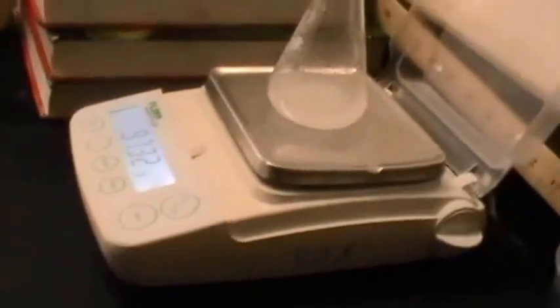And now we've gone down 0.09 grams. A little more weighing and swirling action — extra big swirls. Waiting for the reaction to be done. Erica is doing the math, diligently working.